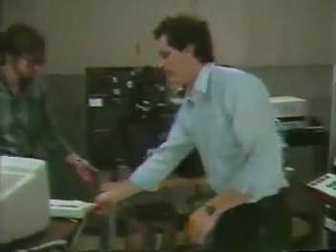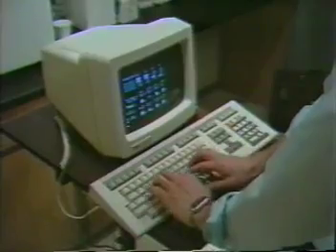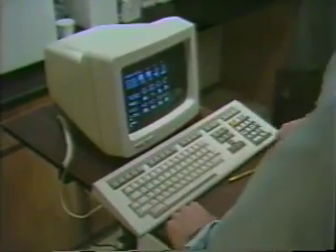Let's get going. Now that the FACS is adjusted to standard levels, Tom can bring his desk onto the screen by typing the word desk on the keyboard. Where do you want to start? Well, let's actually start at C1. That's where we have the unstained control. All right.